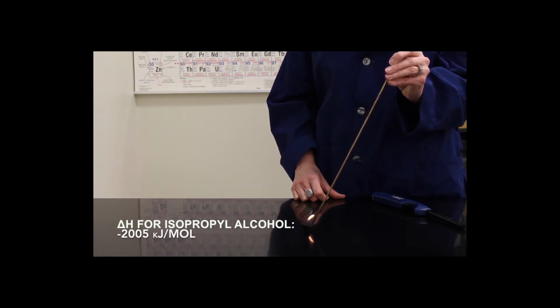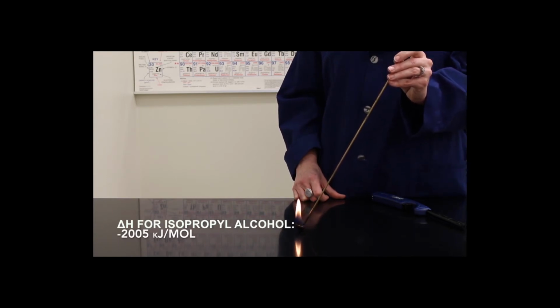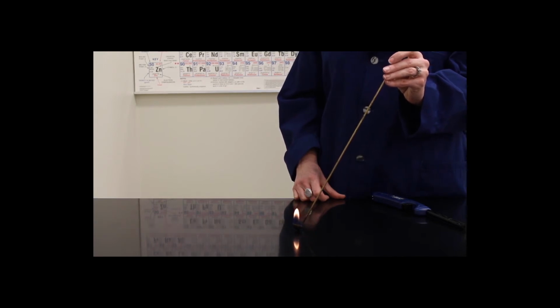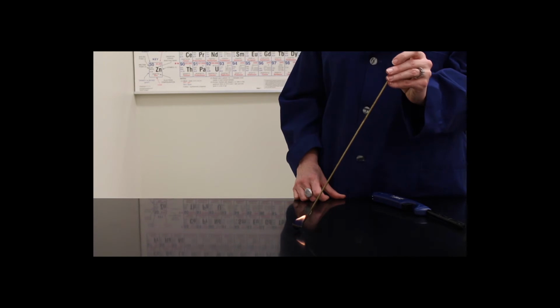The heat of reaction is actually a little bit larger, though, than ethanol because there are more bonds to break and reform in the reaction. You'll notice that this flame is slightly more yellow or orange, and this is because it is less clean burning, but again, it's a relatively small flame.